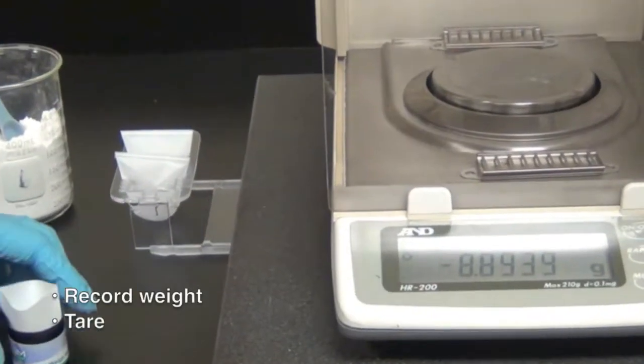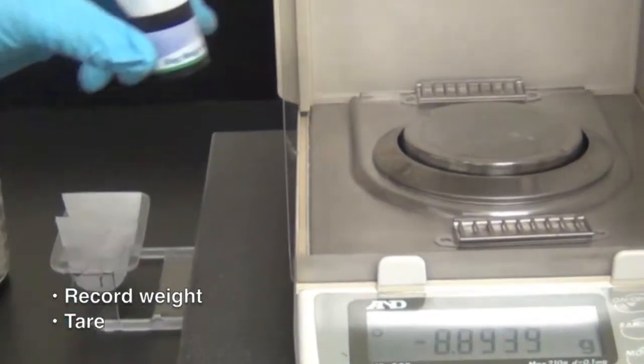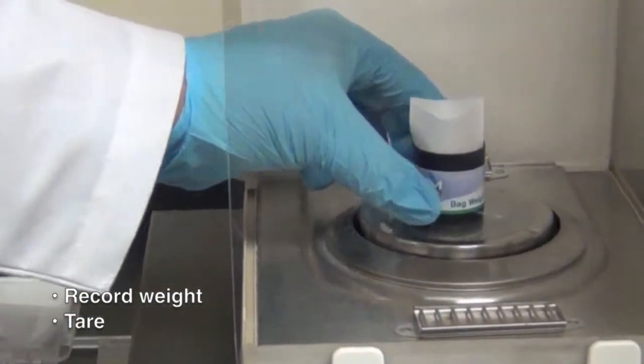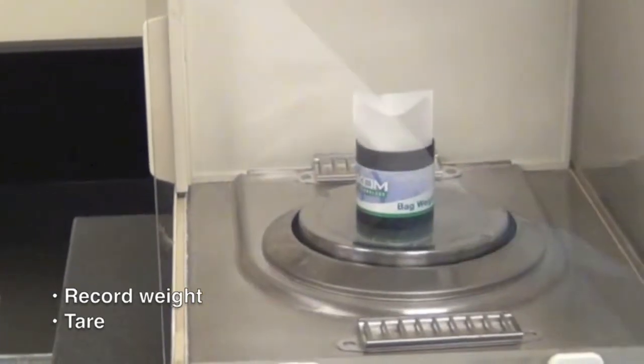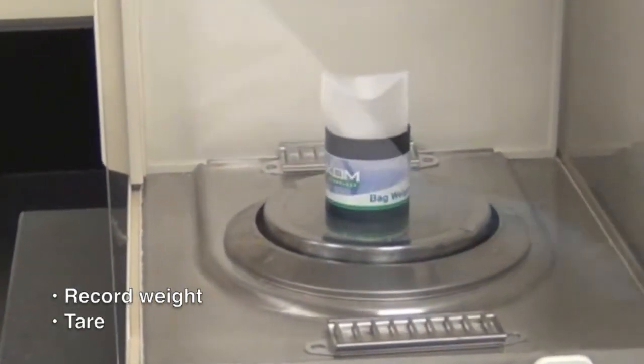Because some diatomaceous earth will be transferred to the pencil, record the weight and tare after creating the indentation.